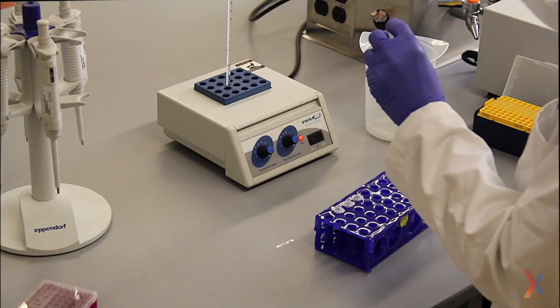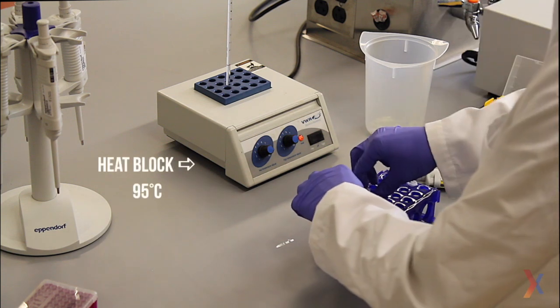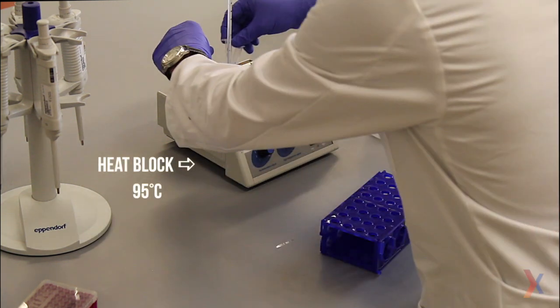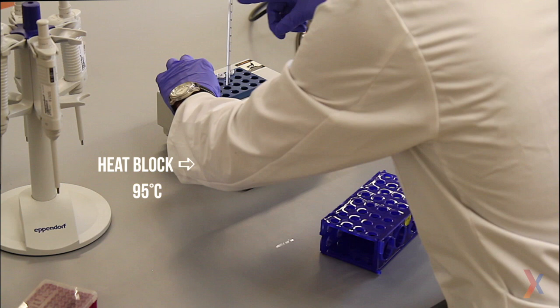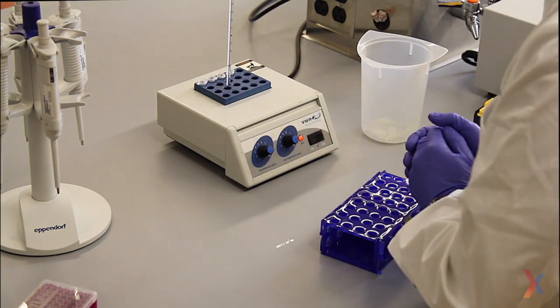Once all four samples are prepared, I will move them onto this heat block, which has been set to 95 degrees Celsius, and they'll stay in here for five minutes.